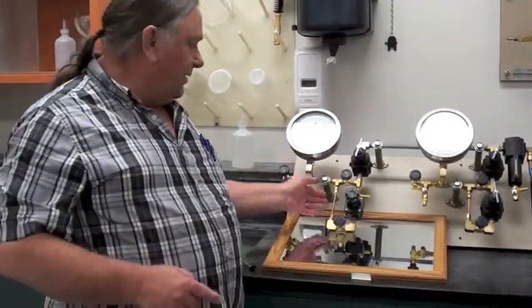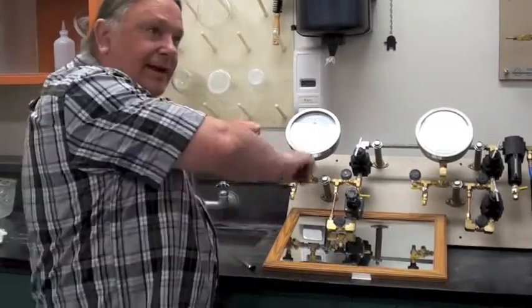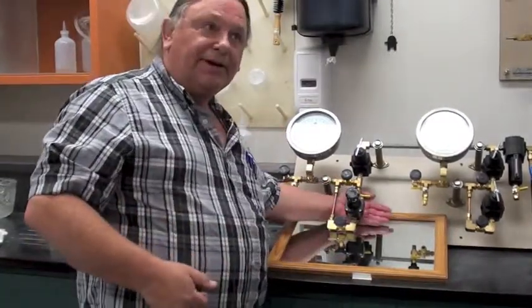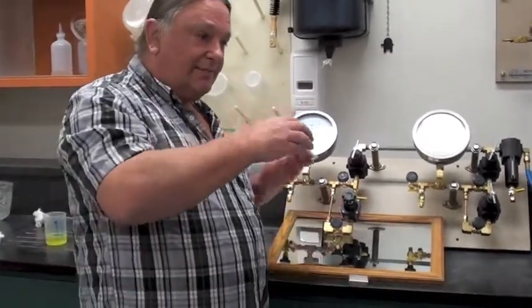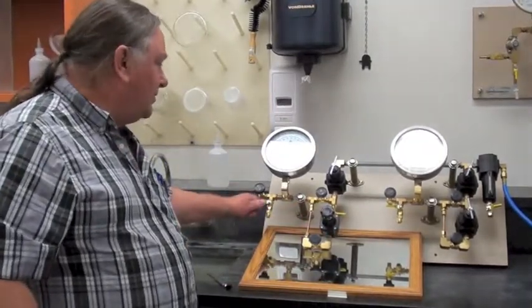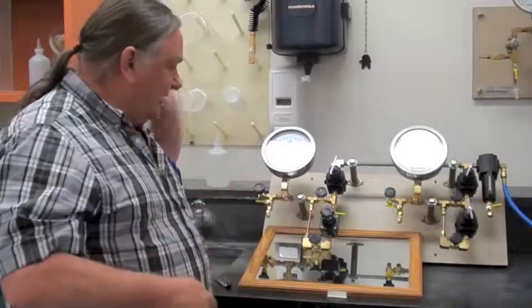There's one other way you can run into a problem with this Nullmatic, and it's called ram pressure. I'm going to leave these off because I don't want to do it. But if you do a very quick off, on, air pressure rams in the back of the Nullmatic, and a seat will actually come out, and then the high pressure air will be coming through all the time. You can fix that by taking off the brass, removing the plastic pieces, pressing the seat back in, and then replacing the pieces. But never ram air pressure, never quick, always slow. Slow is okay. Very quick can cause trouble. It's like a hammer. Very quick air pressure is like hitting this thing with a hammer.